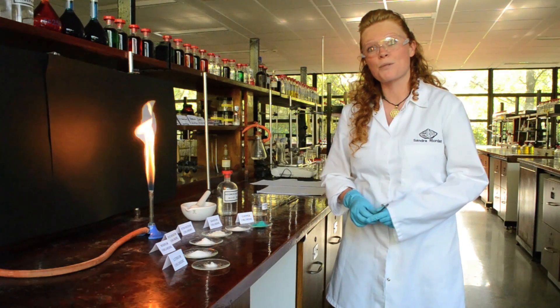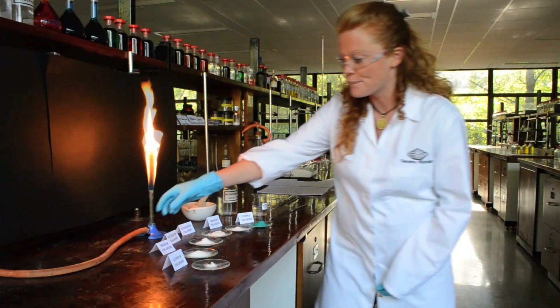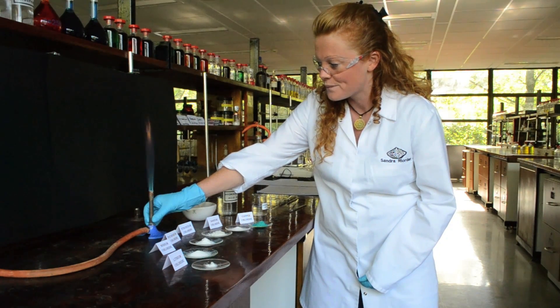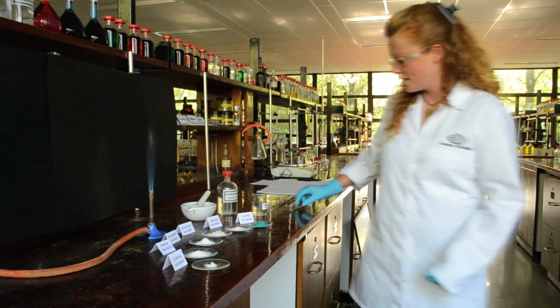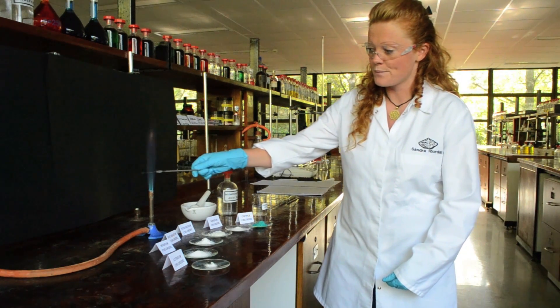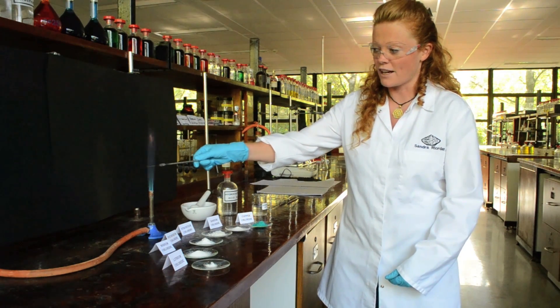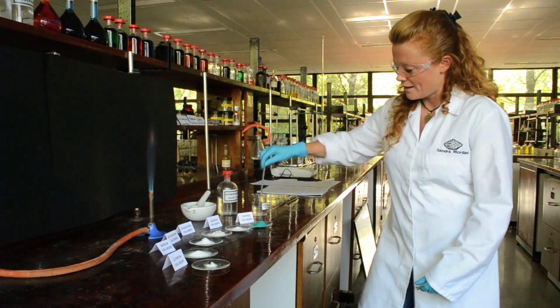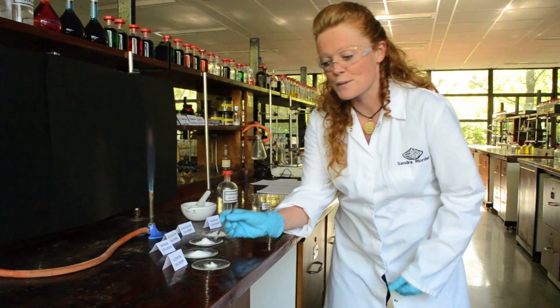I'll now take you through the flame test procedure. I'll start by adjusting the Bunsen flame so that we get a blue flame. The blue flame is the hottest part of the flame. I then take the nichrome wire and place it into the Bunsen flame and ensure that there are no colours given off by the nichrome wire, so it's clean. I then place it in some hydrochloric acid and this helps to pick up some of the salts.